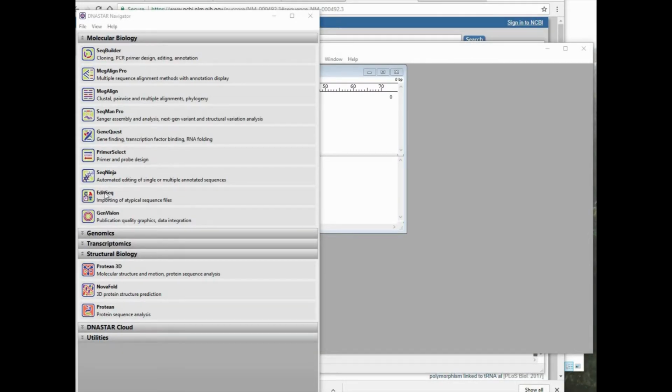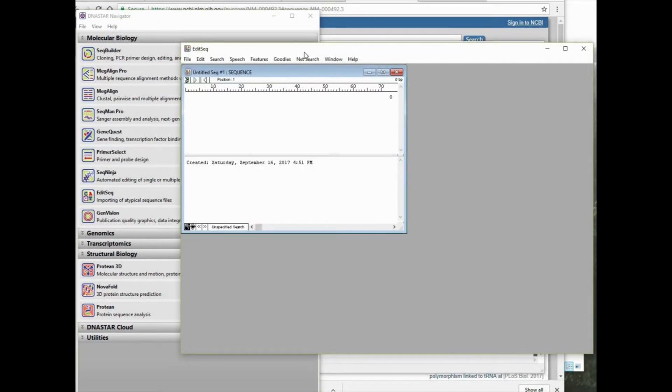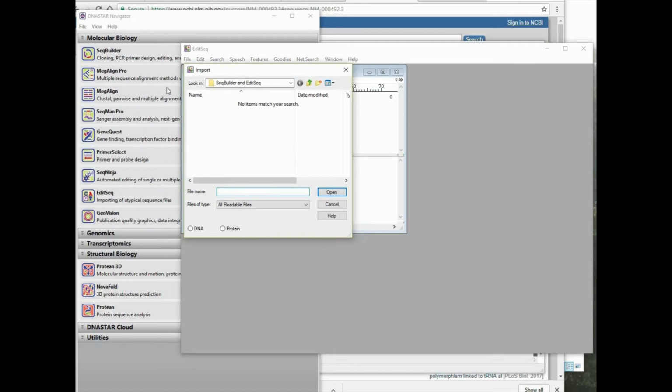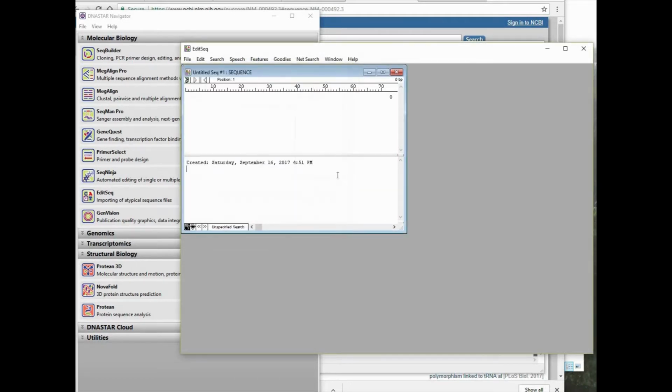So let's launch EditSeq from the DNASTAR menu. The application opens, and then we go to the File menu and choose Import. We go to the File section where we know we've saved the CFTR GenBank formatted file. But as we can see here, even by looking for the various accepted formats and choosing GenBank, it still isn't recognizing the file that we saved. We noticed that it was looking for a .gbk formatted extension.